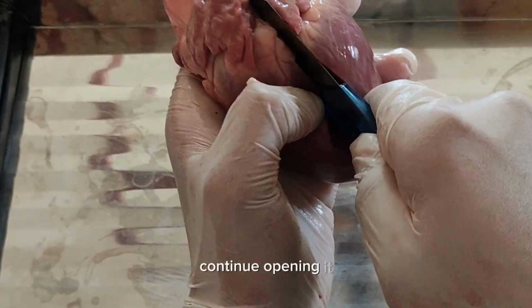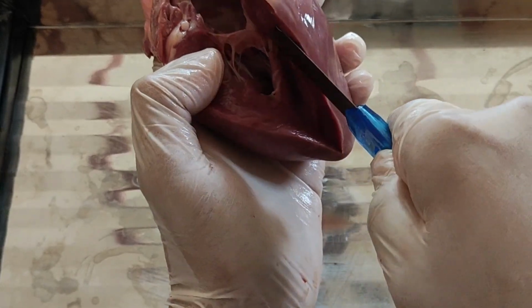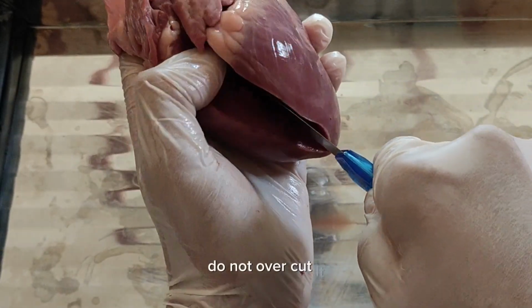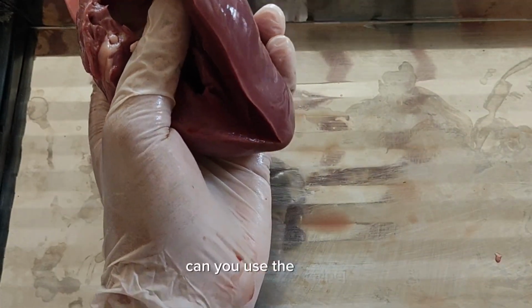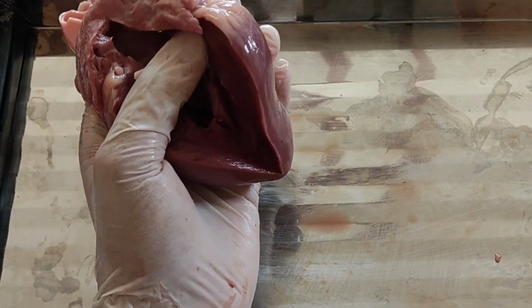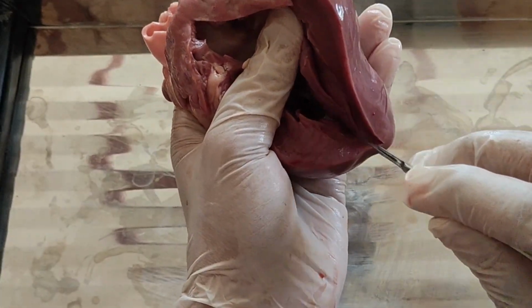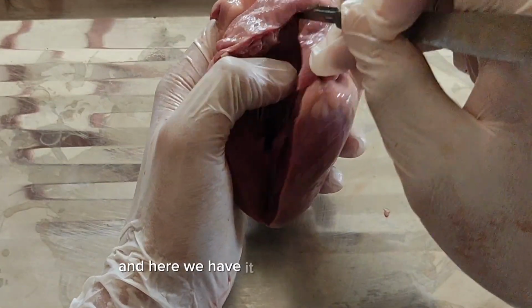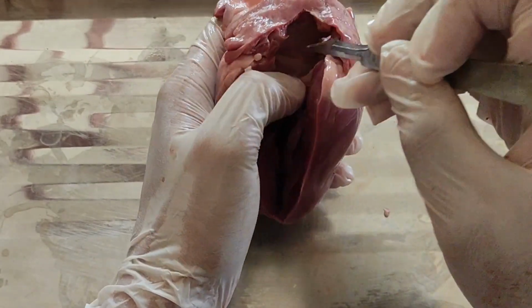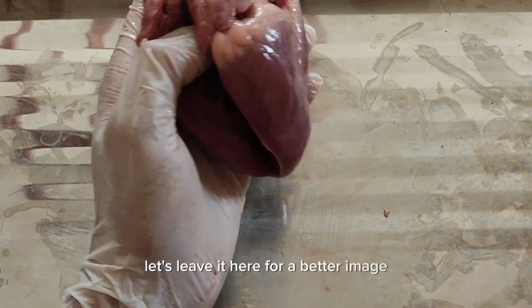Continue opening it. Just cut and cut, very gently though. Do not overcut it. And here we have it. Cut through this atrium. Here we still have the atrium intact. Let's leave it here for a better image.